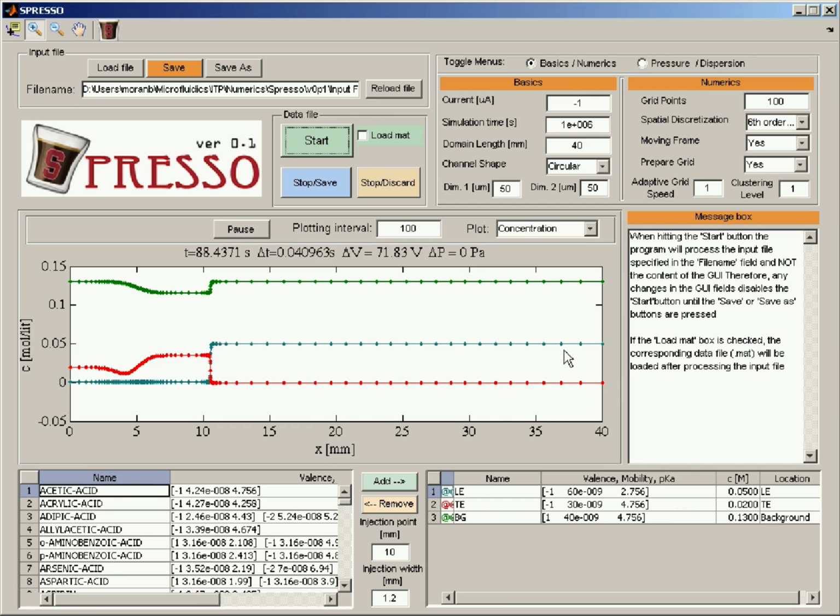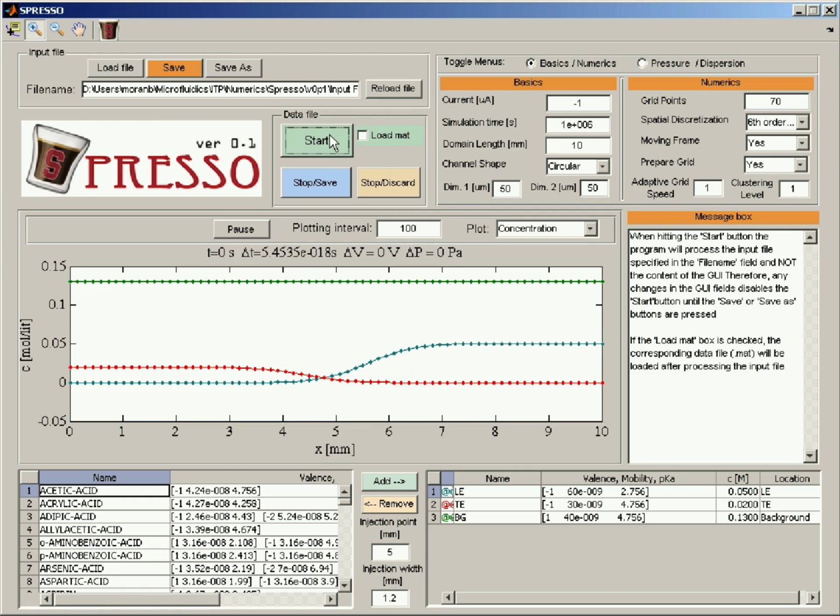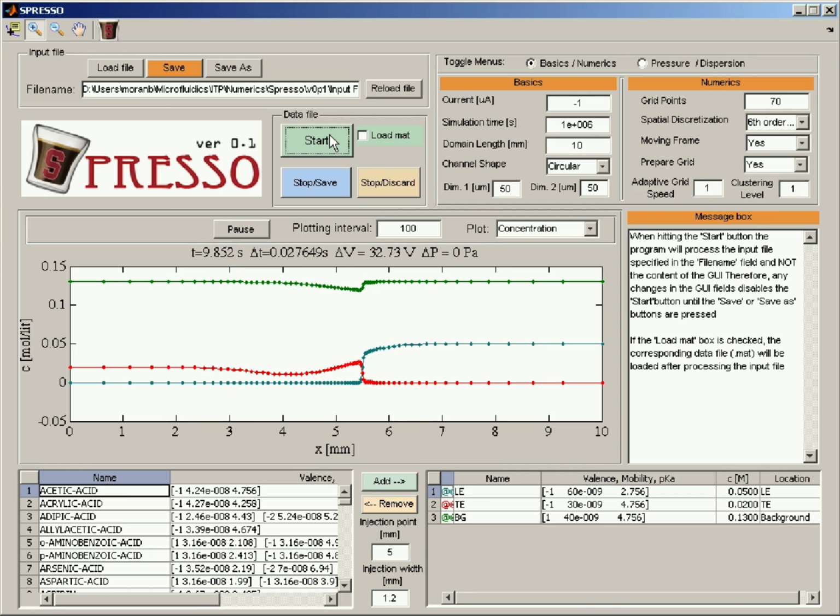If you have the source code, you can of course change this to use other lines or different locations in the channel. To show you why this might be useful, I change here the length of the domain to be 10 millimeters instead of 40 millimeters before, and also reduce the number of grid points to be just 70. So if I run this case again now, you'll see that we get the same solution as before, but it will be much faster because we have fewer grid points because the domain is smaller.